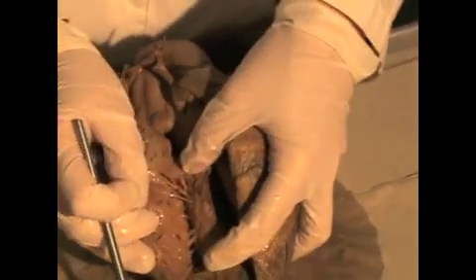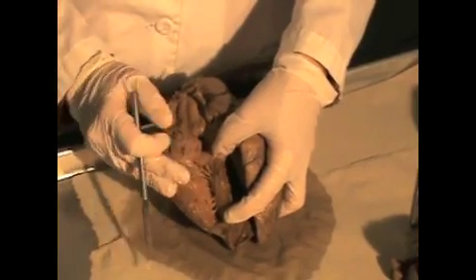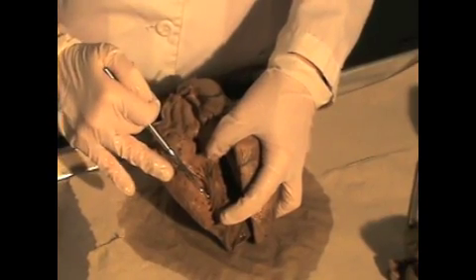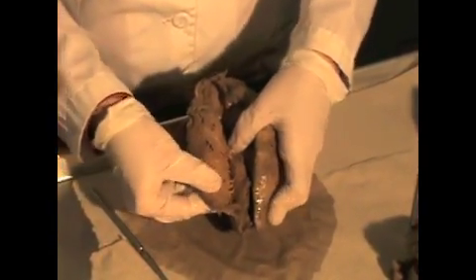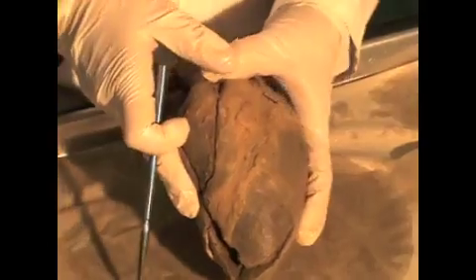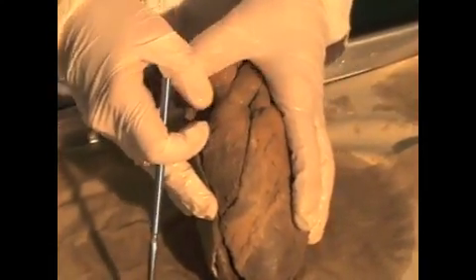It looks kind of spongy, like spongy bone. And this is called trabeculae carneae, which literally means spongy flesh. So the arrangement of the muscle down here near the apex that characterizes the inside of the ventricles is called trabeculae carneae.